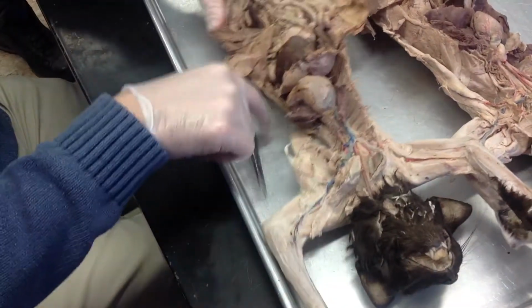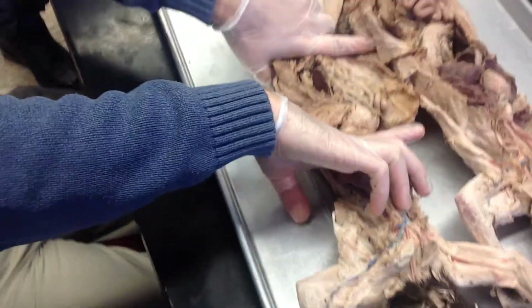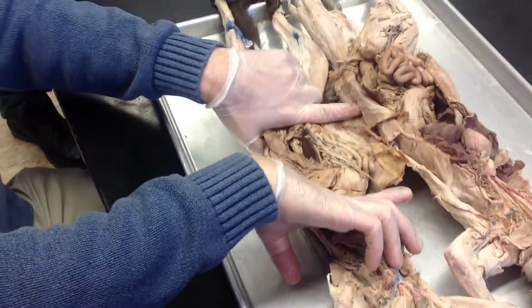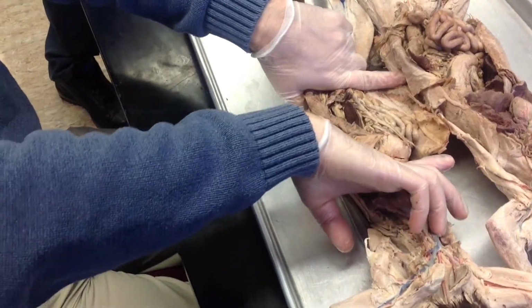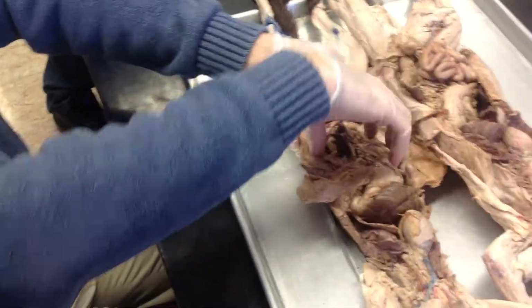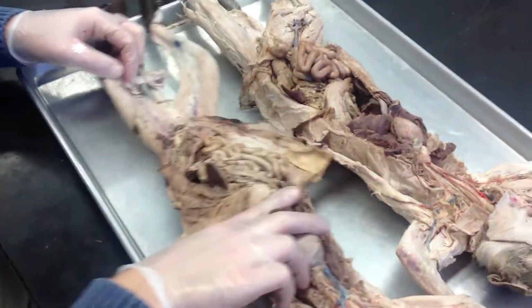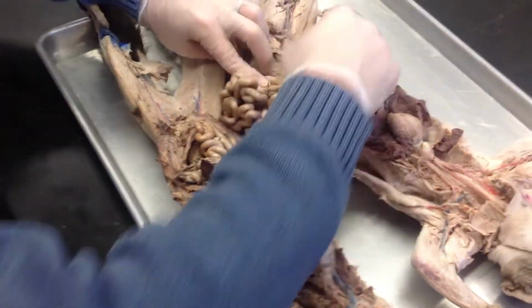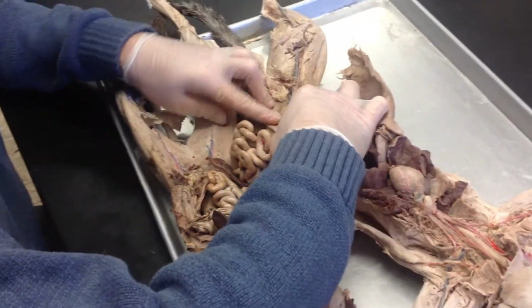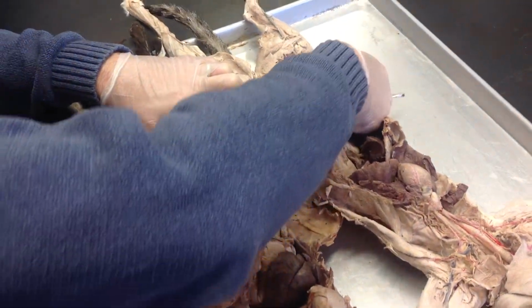All right. Here we see the abdomen. I think you would do yourself a service if you ignore everything between my two fingers for now. After the lab midterm, we intend on spending half of a semester going through this stuff, but leave this alone for now. You can kind of see where the abdominal aorta splits to make the iliac stuff.